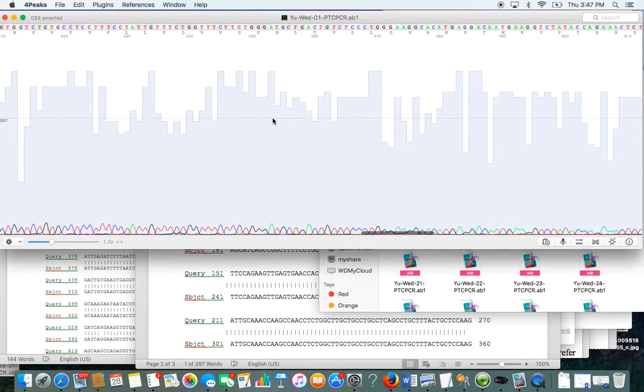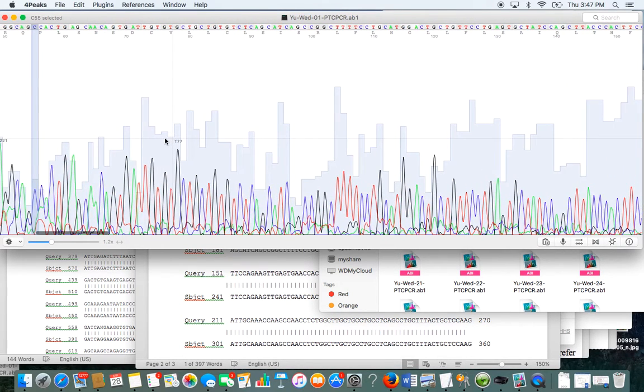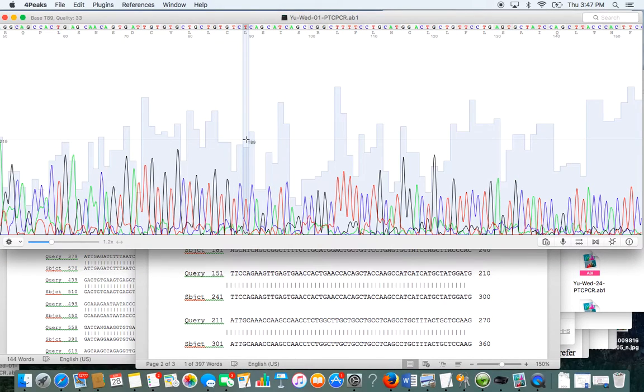All these peaks represent a nucleotide at the designated spot. So at 120 we have, what's this, a G. The important thing to remember is that this is the query and not the subject. The reason I had you write down what the query number was is that you have to go back and look at this number and not the subject, because that's where you're aligning.